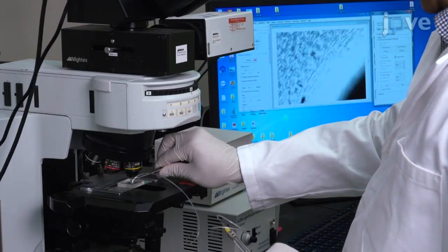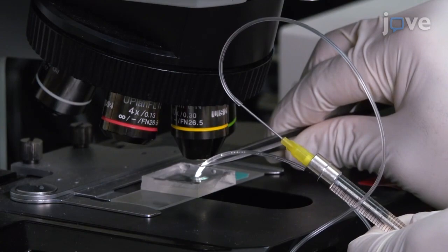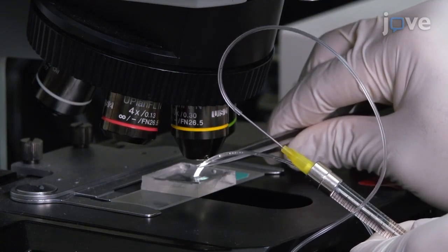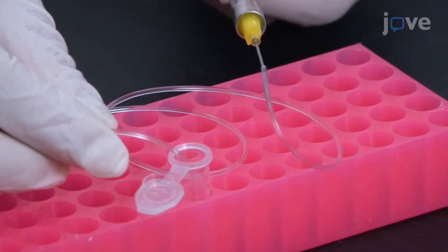This protocol is designed to rapidly isolate cells from screening interfaces for genomic characterization, and this capability is significant because it can combine microscopically observable cell features with genomic information. The targeted bacteria cells from the screening interfaces can be isolated with high spatial precision in an operationally simple manner using this technique. The hydrogels can be implemented in other screening interfaces.